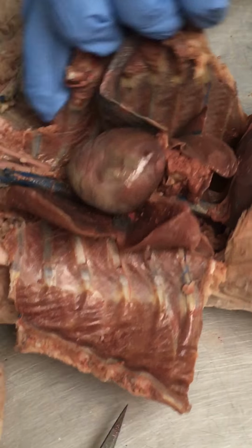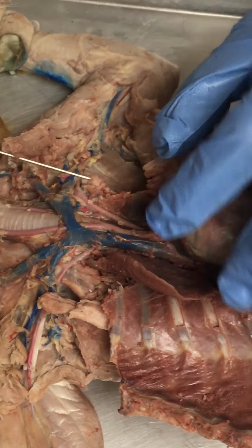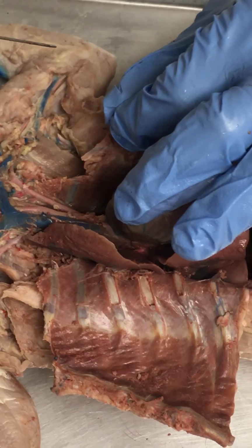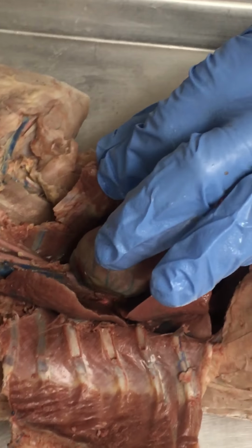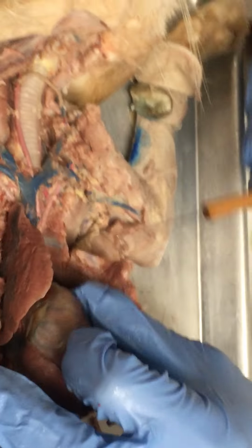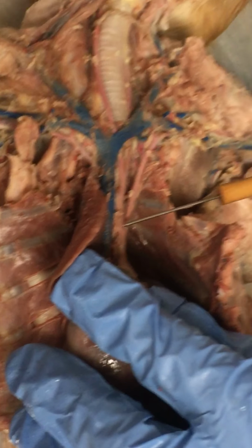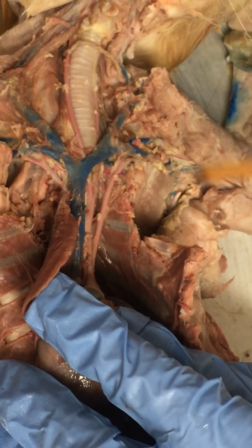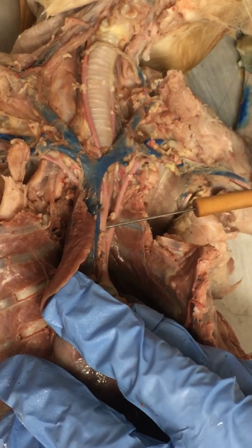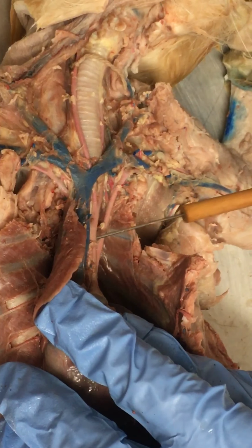Okay, so we're going to run through the branching of the arteries just like we did with the veins. The arteries are not a mirror image of each other, so the right side is not like the left side. They're similar, but not exactly the same, and they're also not quite the same in their branching blood vessels. So we'll just start with this first blood vessel right here. The first one that comes off is the brachiocephalic. Just like we had a brachiocephalic vein, we have a brachiocephalic artery. Brachiocephalic because it supplies blood to the head, cephalic, and the brachial region, the arm.